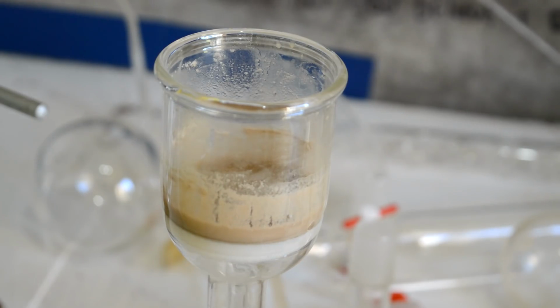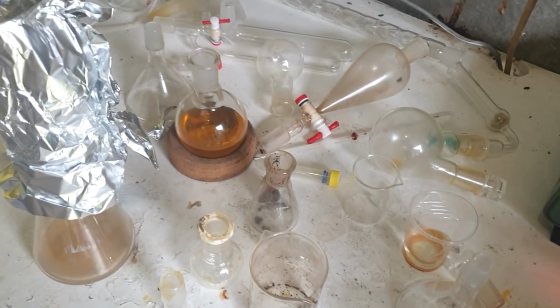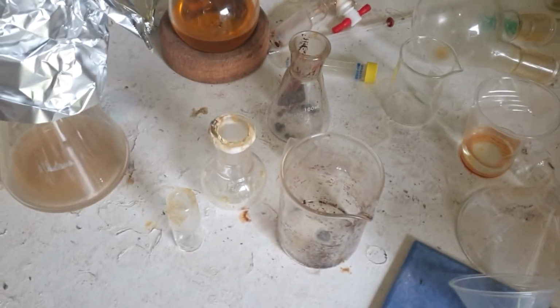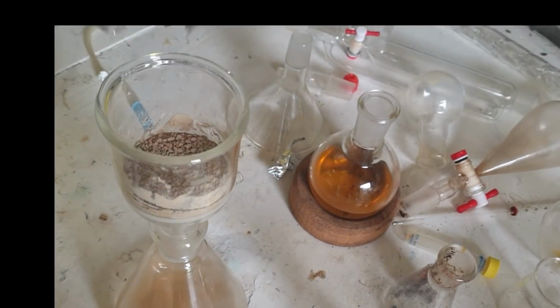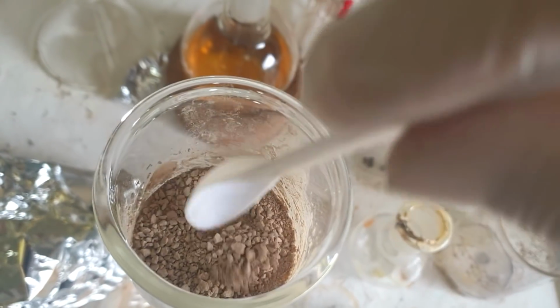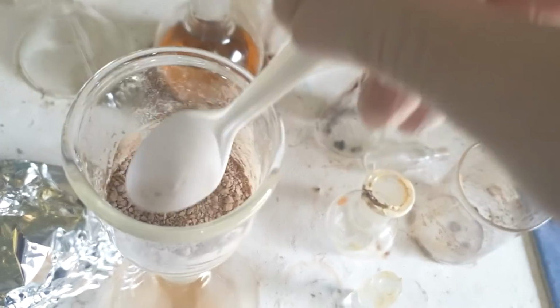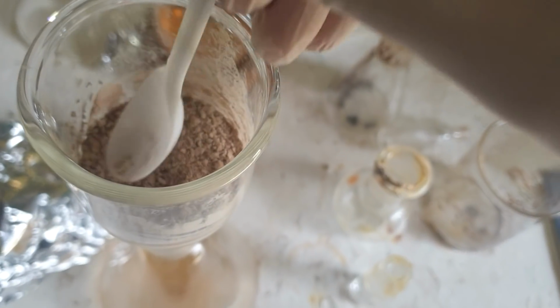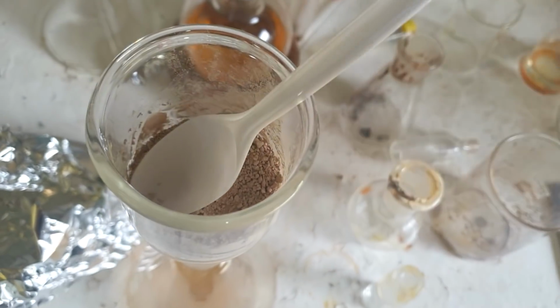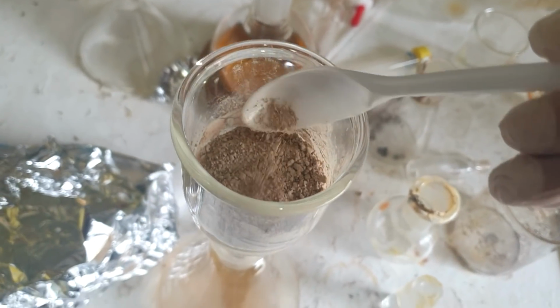We are the next day. This is a bit of a glassware graveyard at the moment. From this experiment, the last one, been churning through the glassware, but I'll clean it up in a second, I swear. Let's have a look at our product. It looks really good. Well, it's brown, and that's not great, but this looks exactly like I was expecting it to. Even the brown color, I was thinking it was going to come out this color. It's not really tar, but it's not crystalline or anything, and it looks very different than our product started out being. This is a lot less dense, it's more like clay or mud.